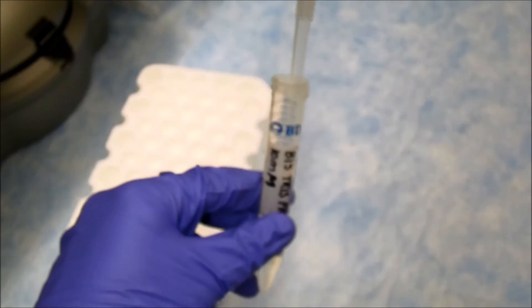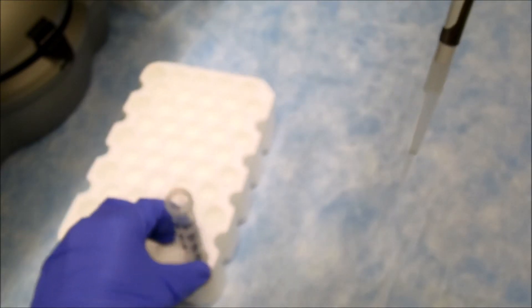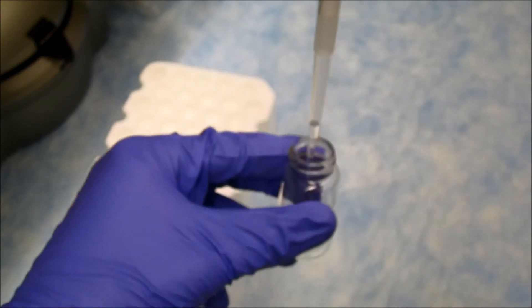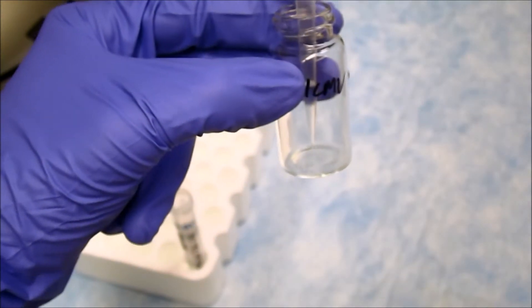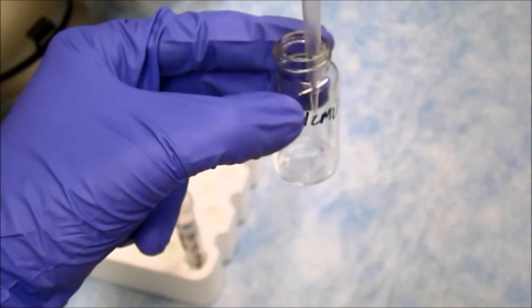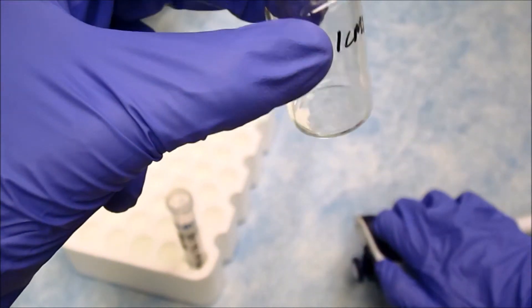I will now show you how they are made. The first step is to take 200 microliters of 10 millimolar bis-tris-propane solution and add it to the lipid film contained in this glass vial. This hydrates or dissolves the lipids allowing them to come together to form liposomes.